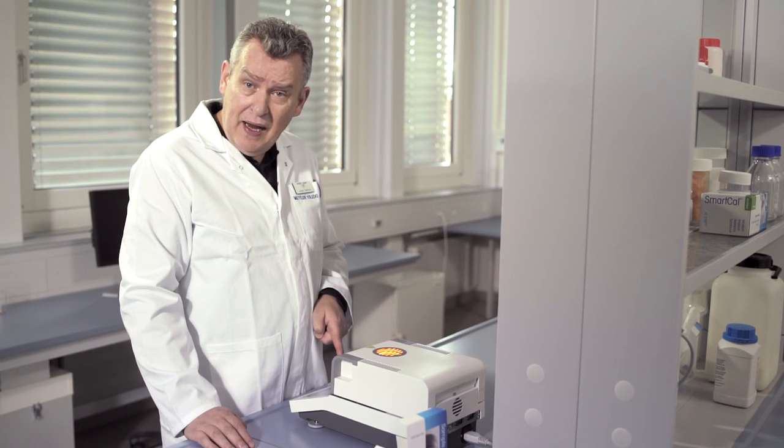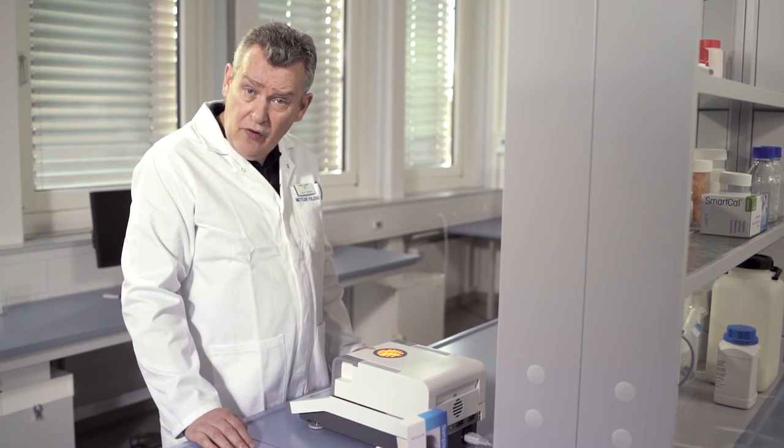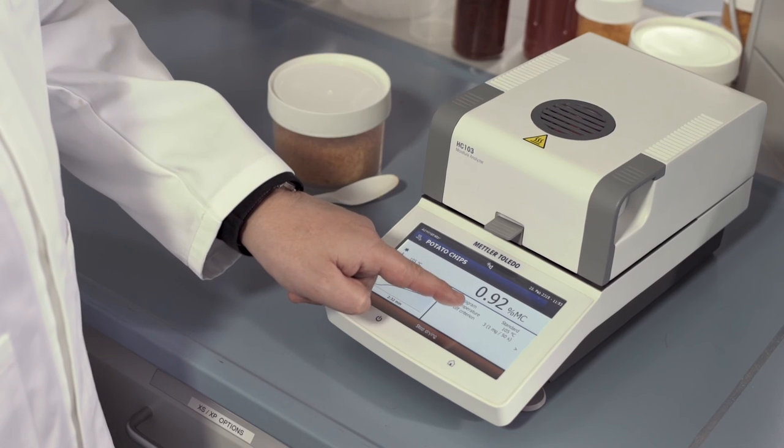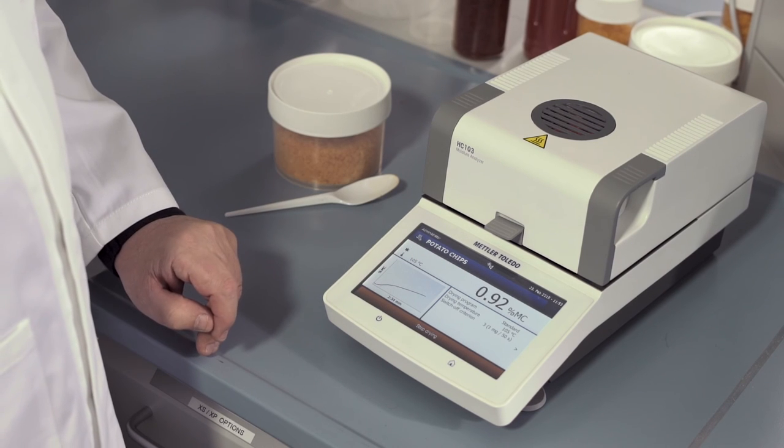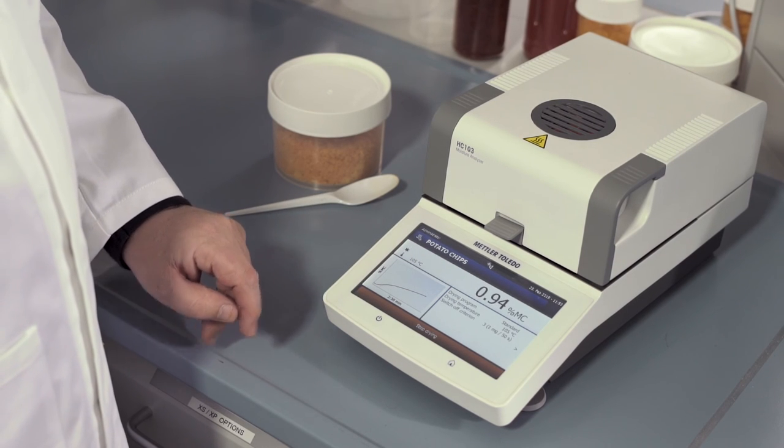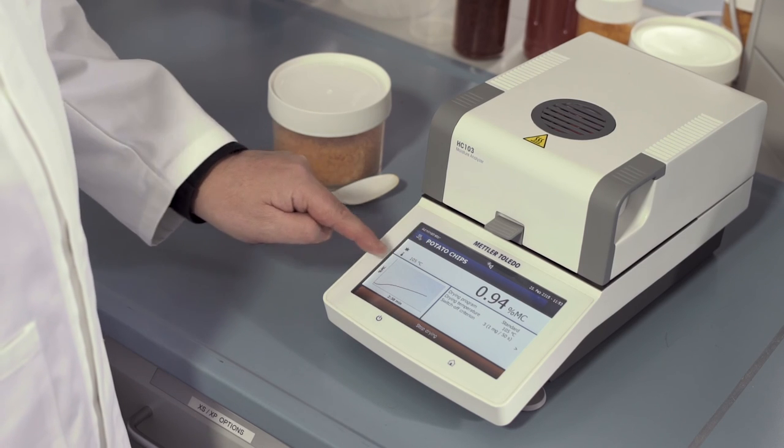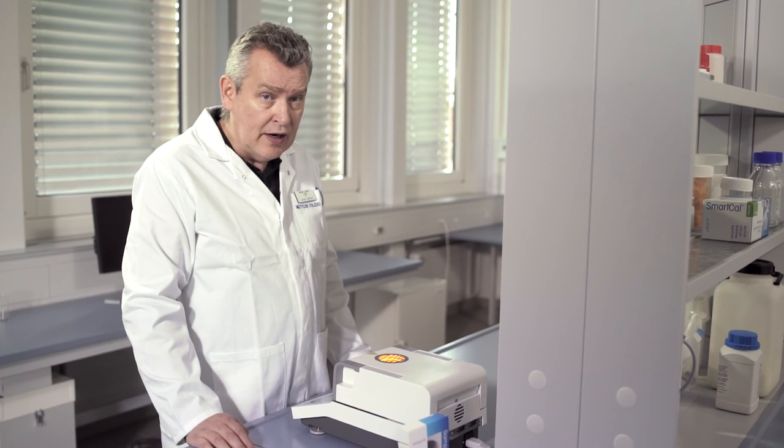Notice the display. You can see the current moisture content, the current drying temperature, and the real-time drying curve, which provides an overview of the measurement progress.